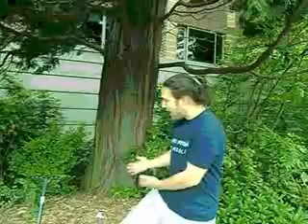And why would we need to know the carbon content of the soil? To determine maybe if there's any biological activity or where the biological activity may be happening, or just to compare it with other areas, just for general knowledge, I guess. Would it also help with growing plants and vegetation? It would. The more active the soil is, the healthier the soil is, and you could choose accordingly what you might want to do. Okay, sounds good.